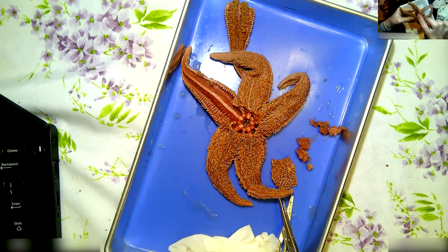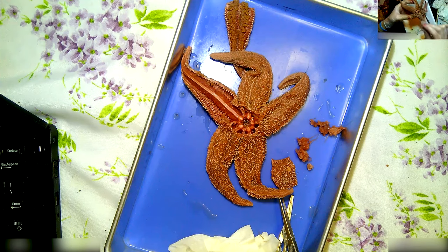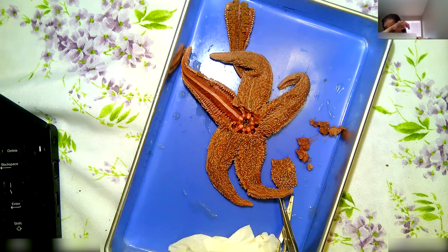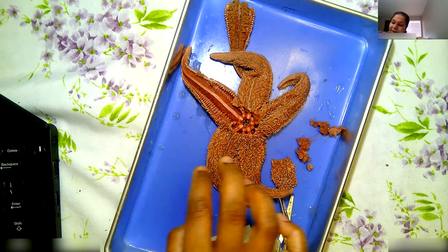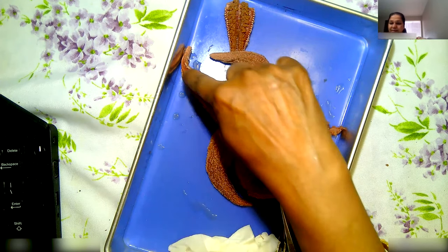Ms. McKittrick is showing her ring canal. That's a ring. I broke some of the bones and it felt weird. Myrna is showing hers — show the other side. That's your ring canal. The pipelines that run through the ring canal into the arms are called the radial canals. These have five radial canals.